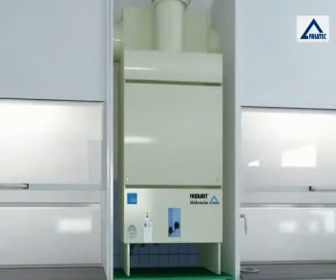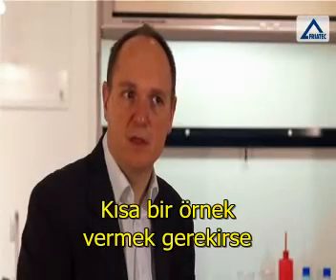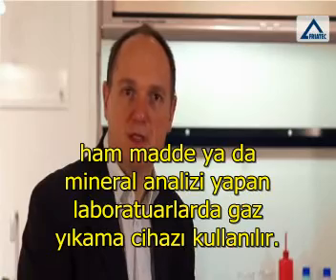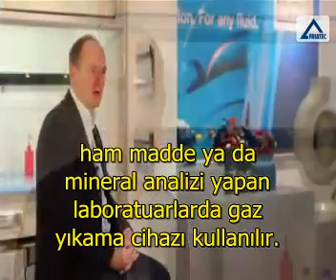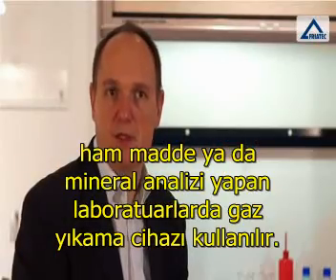Could you please describe a typical application? A short example is laboratories that use fume scrubbers in combination with analysis of raw materials or of minerals.